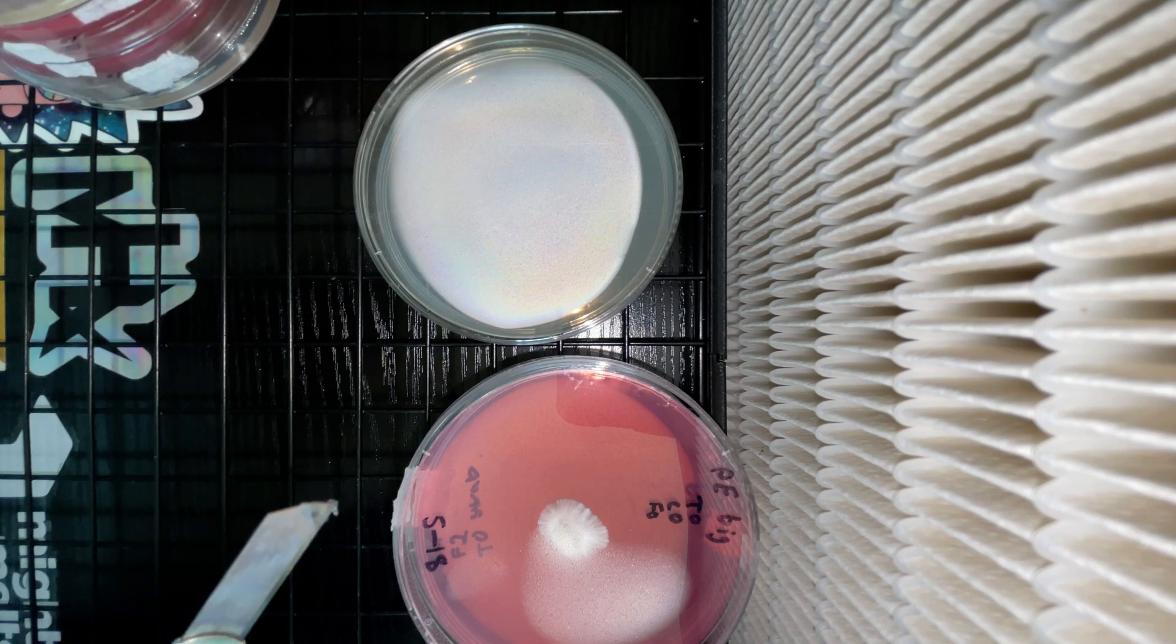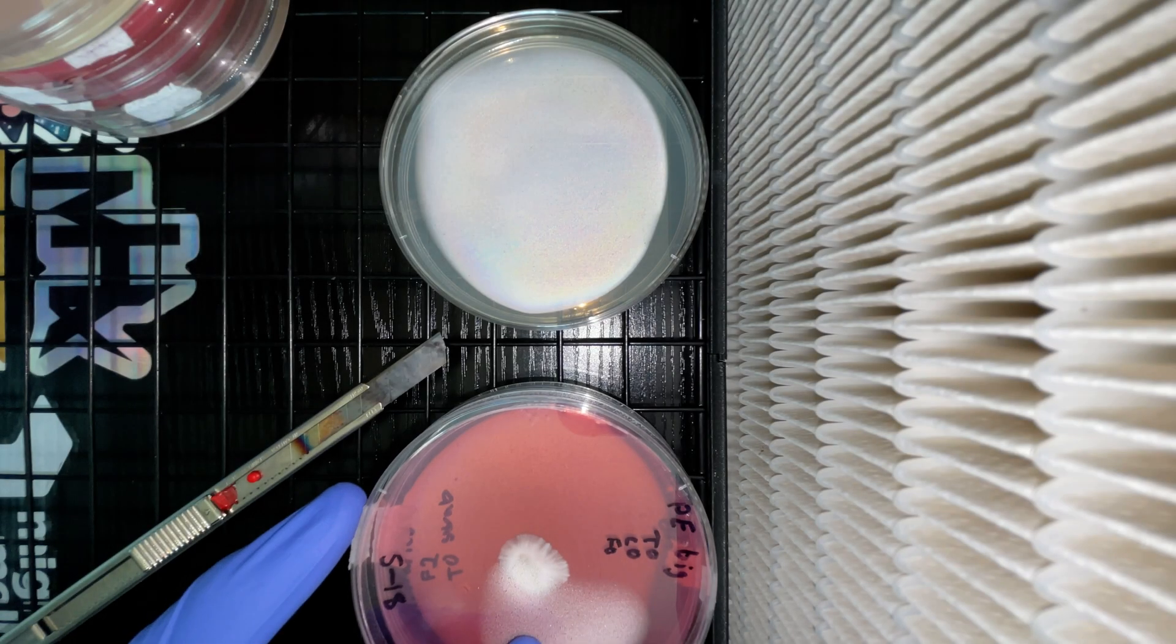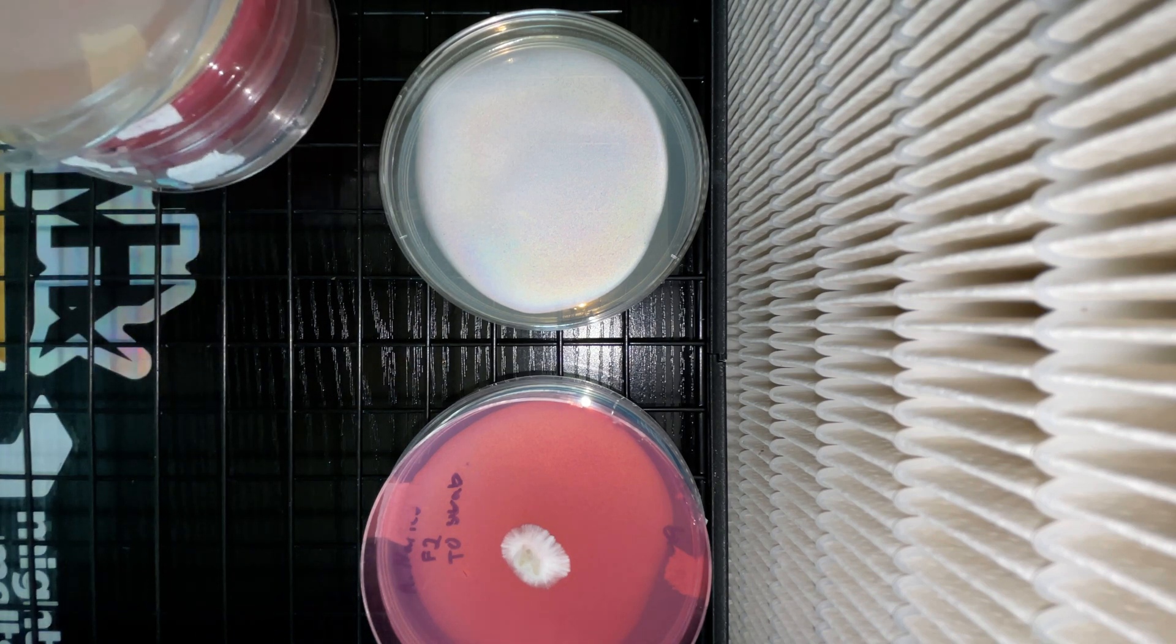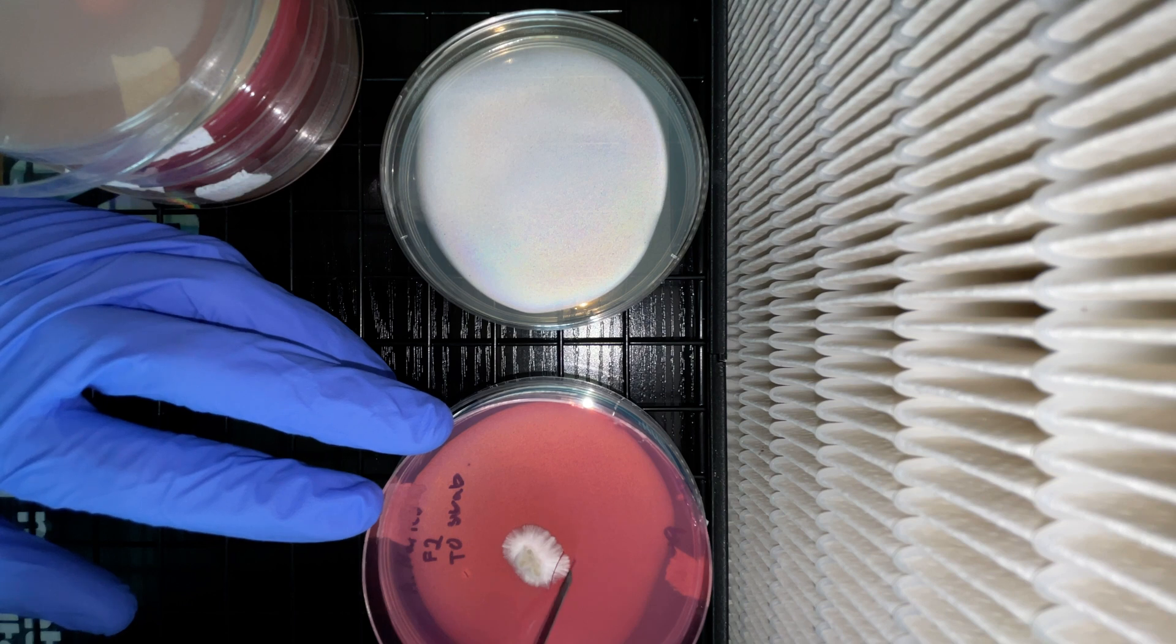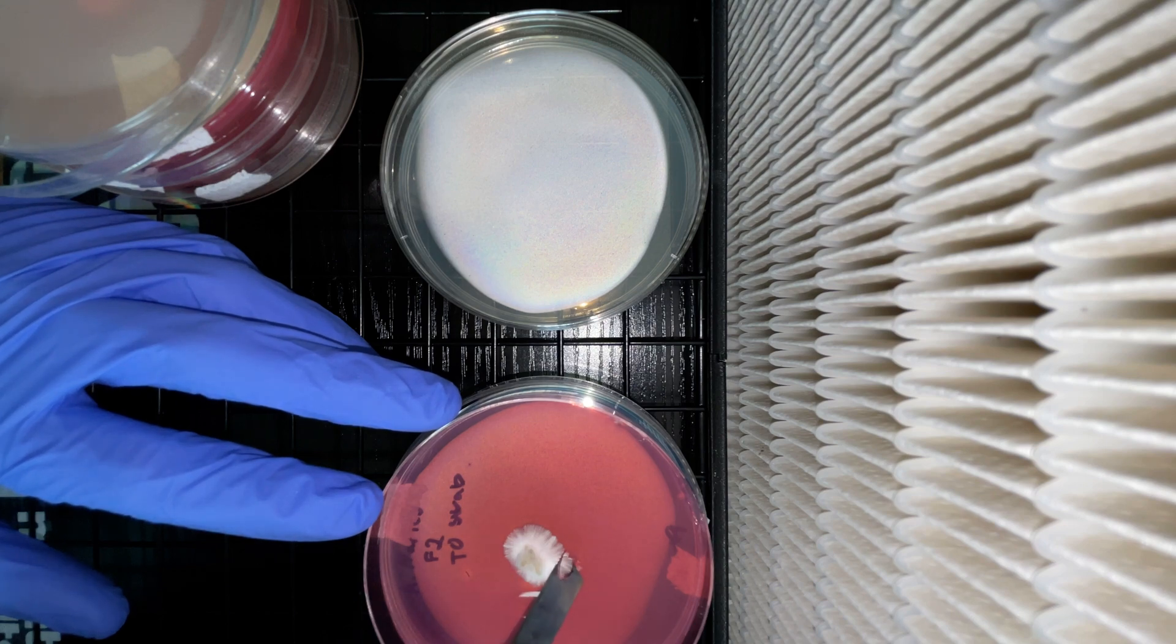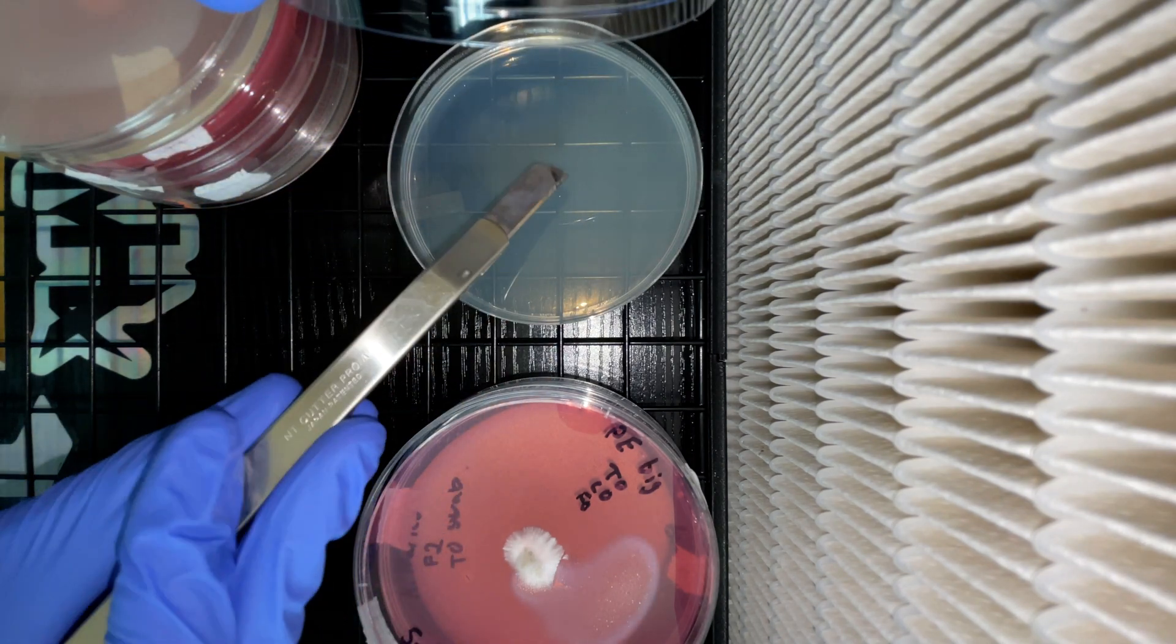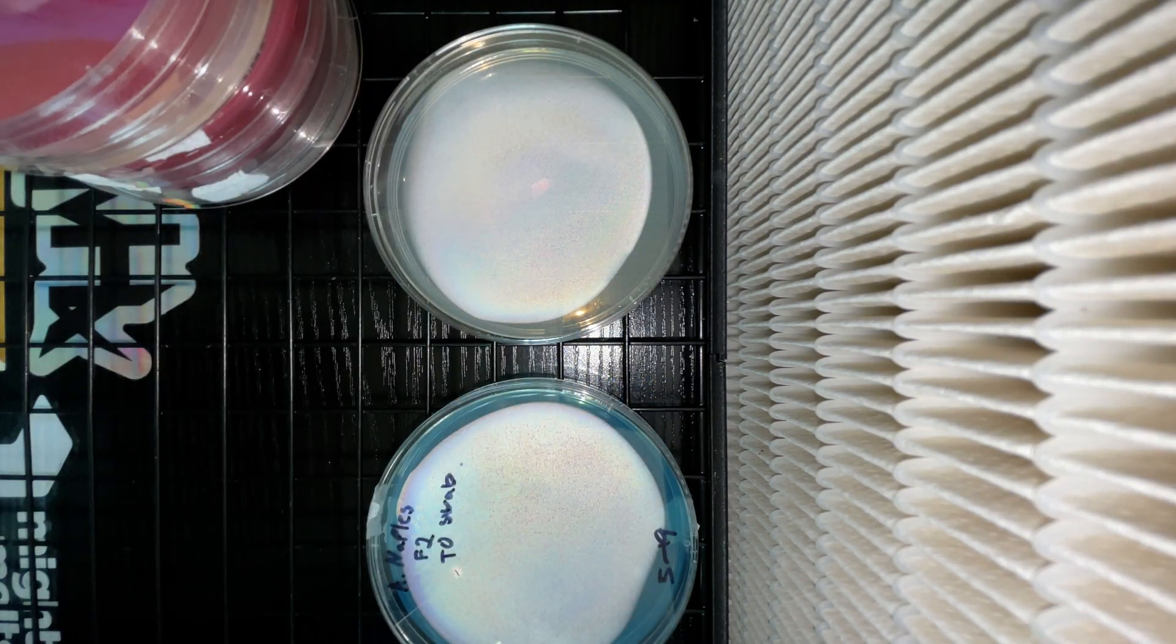To start off, make sure to sanitize all of the surfaces and racks with a sanitizing agent. I use not only 70% isopropyl alcohol but also Lysol in cycles. This will keep contamination to a low percentage. I can't stress enough how important it is to keep everything as clean as possible. This is the most important step in all of mycology. After everything's cleaned up and your blades are flame sterilized, make sure you spray your hands with iso alcohol and let's get to work.